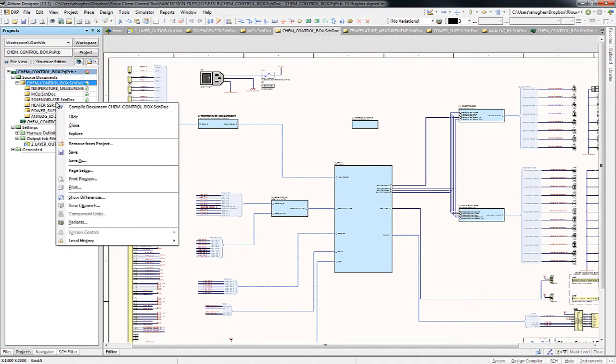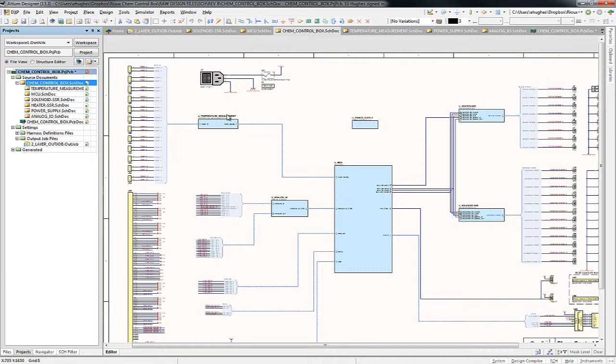So the first, the schematic is made up of multiple pages, and at the top level there's a top level page called Chem Control Box. Now from a user perspective, if you're writing code, this is really what you want to ever need if you want to get the actual data as far as how things are pinned out. And this shows the top level connectors and the signal names.